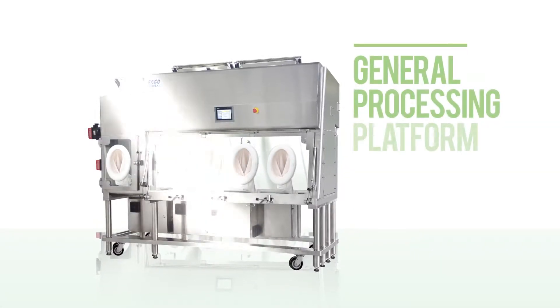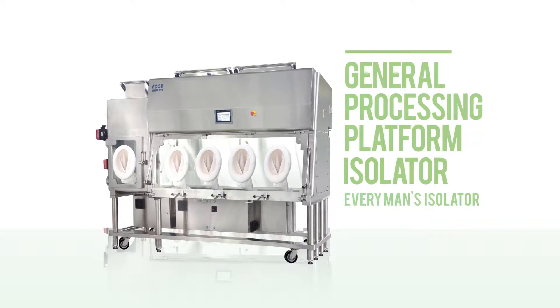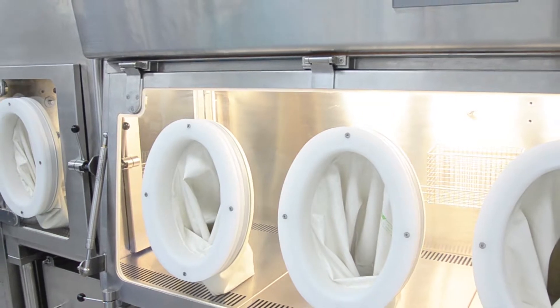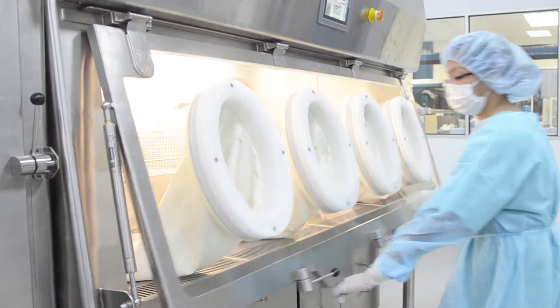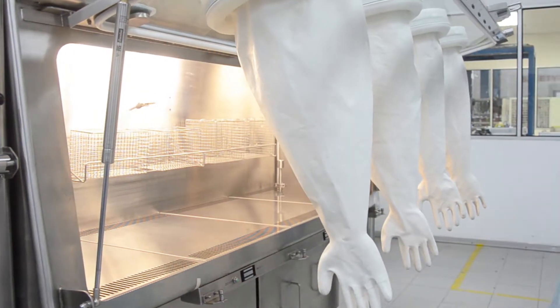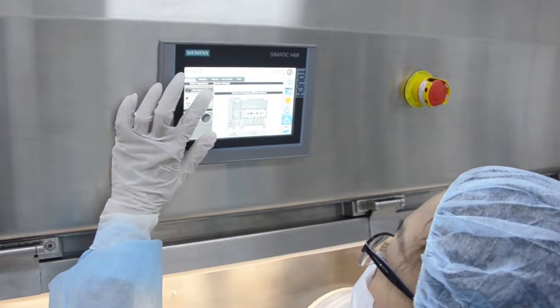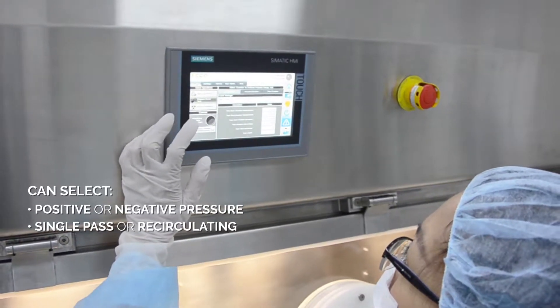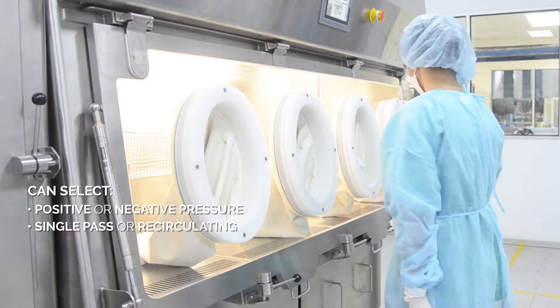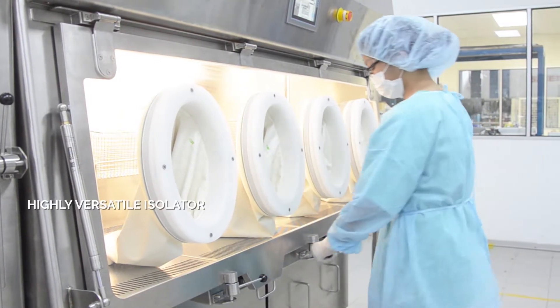Esco General Processing Platform Isolator GPPI — every man's isolator. The Esco GPPI is a highly adaptable unidirectional laminar airflow isolator that can be used for sterility testing or other processes that require an ISO Class 5 or Grade A aseptic environment. The GPPI's advanced control system allows the operator to select either positive or negative chamber pressure, as well as single pass or recirculating airflow patterns.